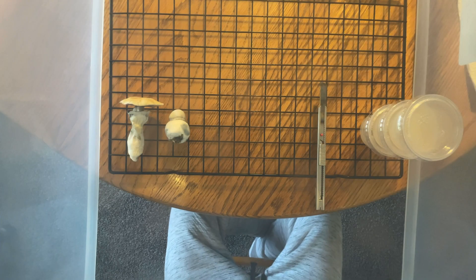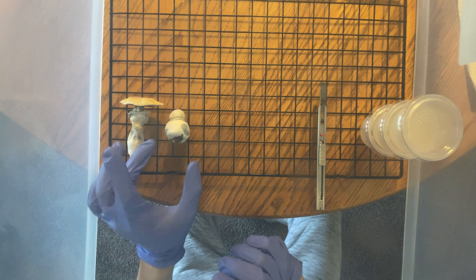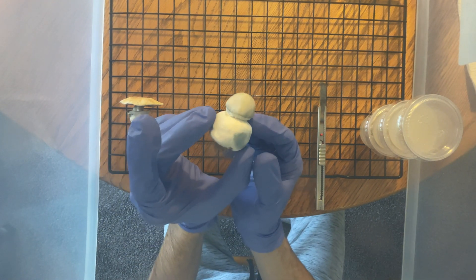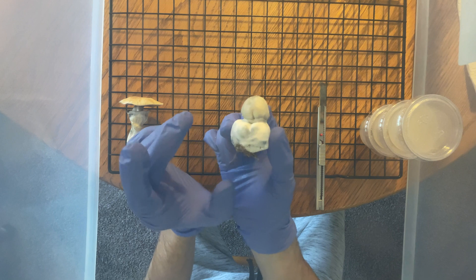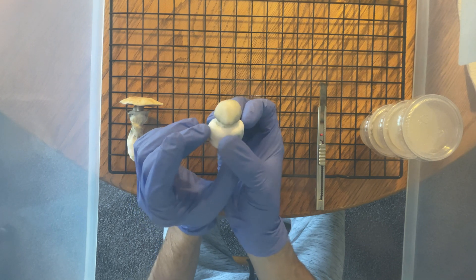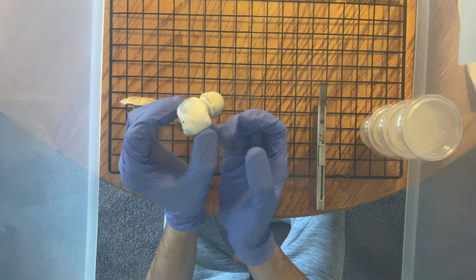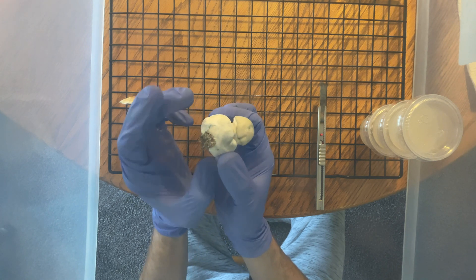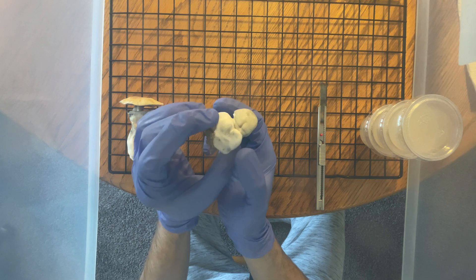Now that everything is cleaned, it's time to set up my area to ensure that I have everything in order before I even get started. This time around, I decided to use this baking rack to keep everything elevated off the table. Hopefully this improves contamination rates. I haven't had much of a problem quite yet, but still would like to avoid it at all costs.